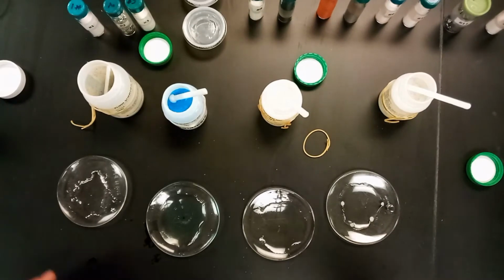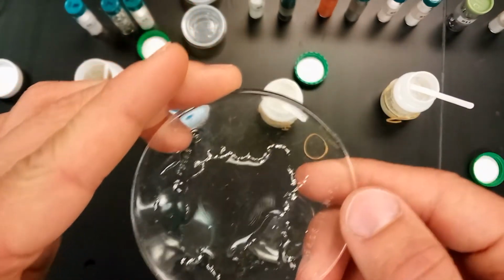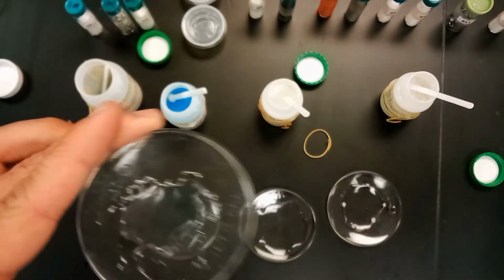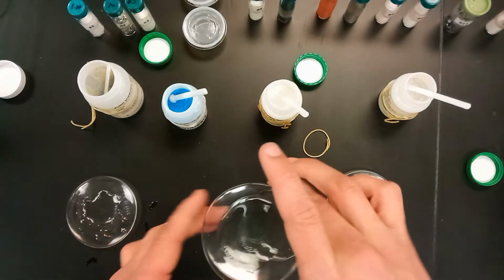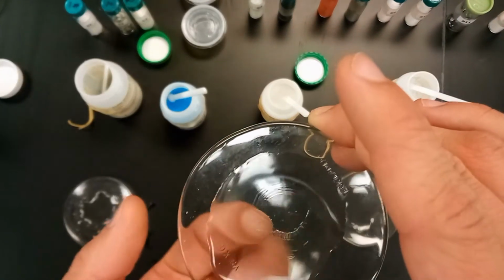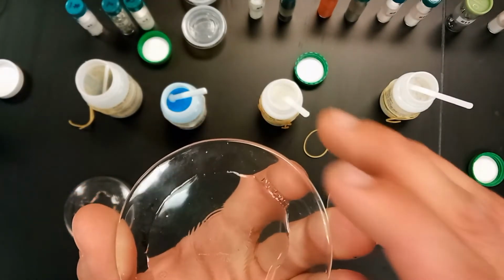So here we've just let this sit for probably a minute even. And here's the zinc. You can see the zinc's kind of on the edges, the water kind of pushes it out. No dissolving, kind of as you'd expect with water and metal. Here, you've got the copper sulfate. You can see there are a few crystals still in there, but if we gave it some time, those would dissolve too. Copper sulfate is soluble in water.